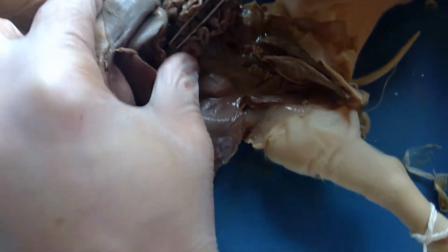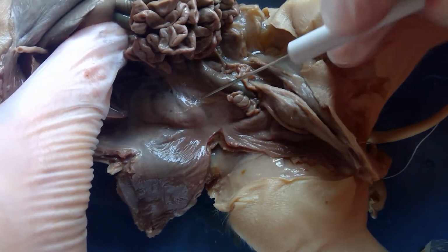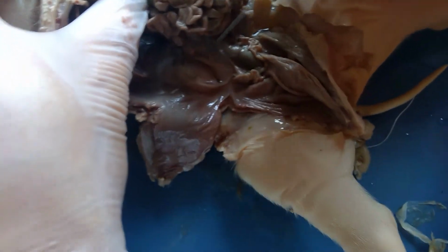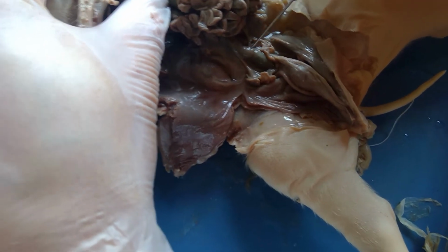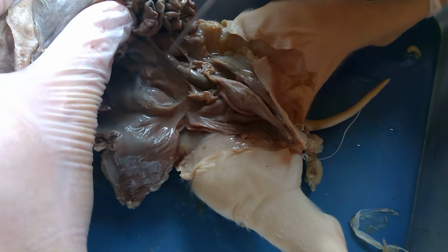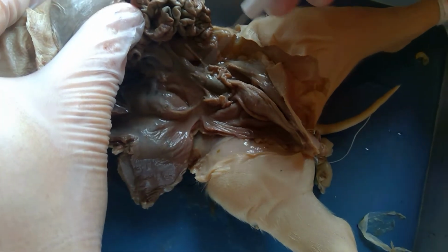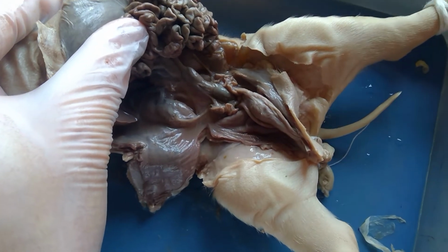And again, if I look at this view here, now I can also see the other kidney. And kind of clean, moving away some of the stuff. The other ureter, and again, there's still the ovary and the fallopian tubes. And this last part down here is called the descending colon. So at the base of this is the rectum, and this is where poop, the feces, will sit until it is ready to leave through the anus, which we already saw from the outside.